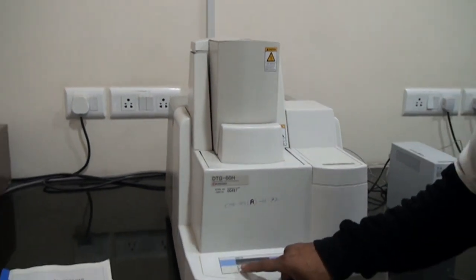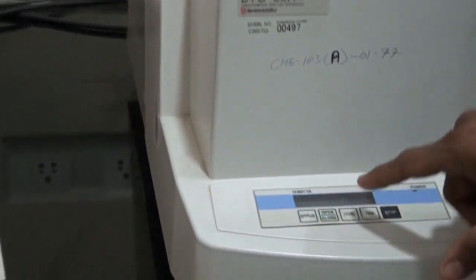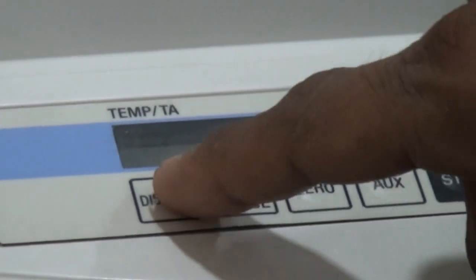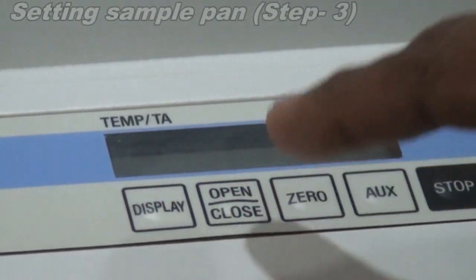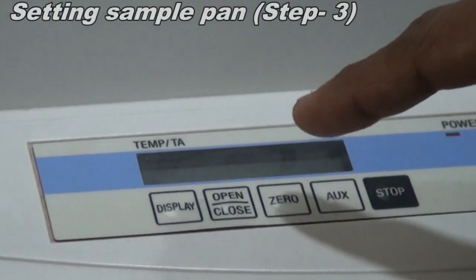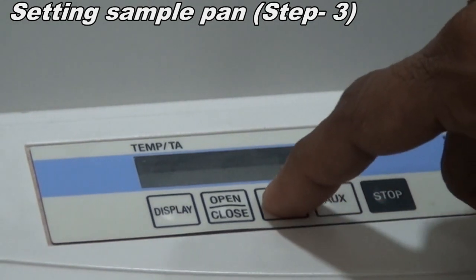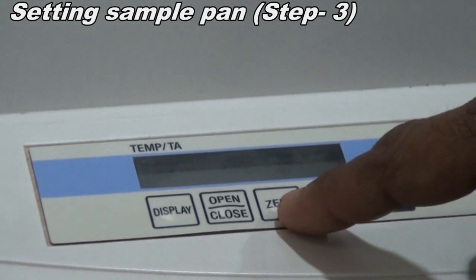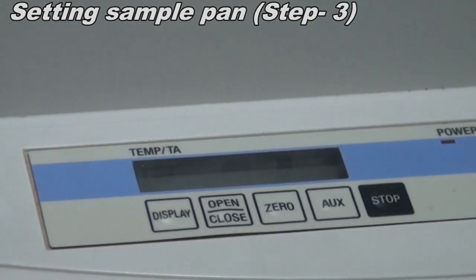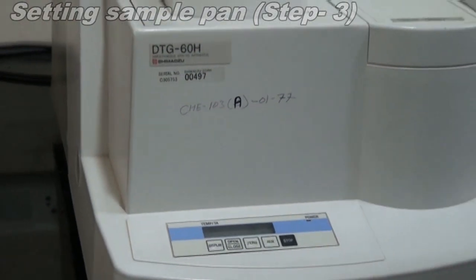Then, before starting your experiment, you need to check your weight. It's coming 7.091, okay, as we measured. Then we need to check that the DTA signal should be 0. It is showing some error, 0.529. After clicking 0, it will come to 0. If it is still not coming to 0, then you need to wait for 1, 2 or 3 minutes, and it will come to 0.